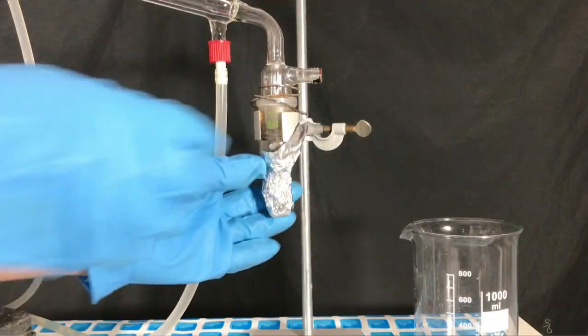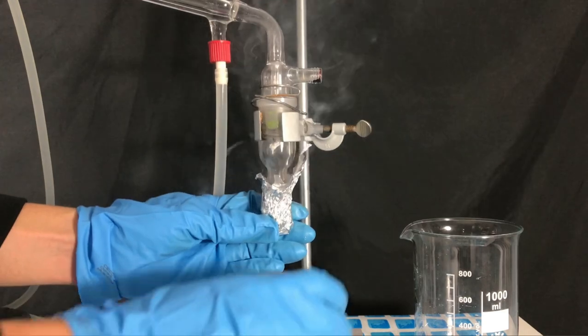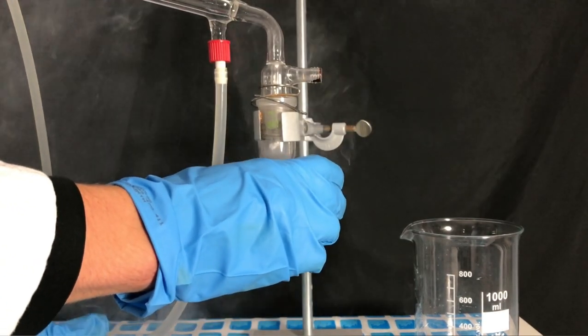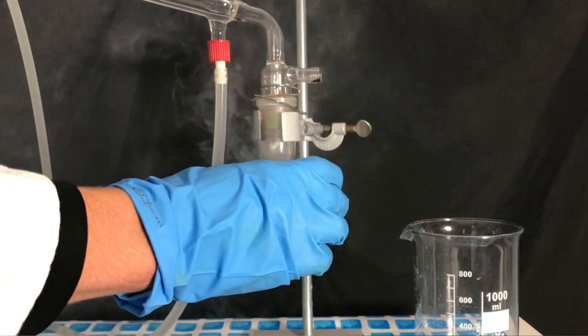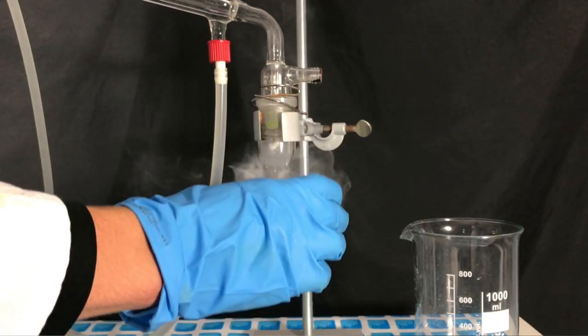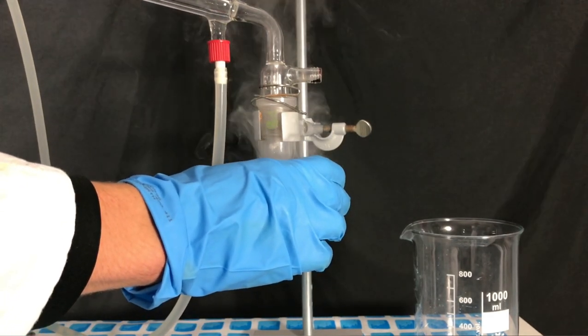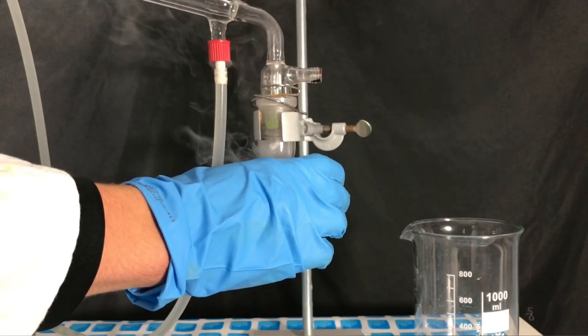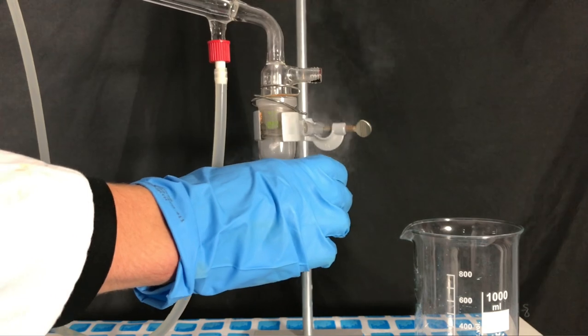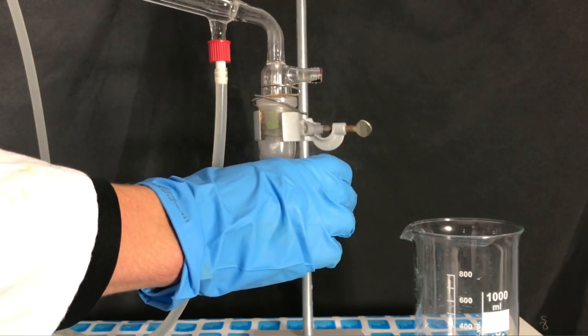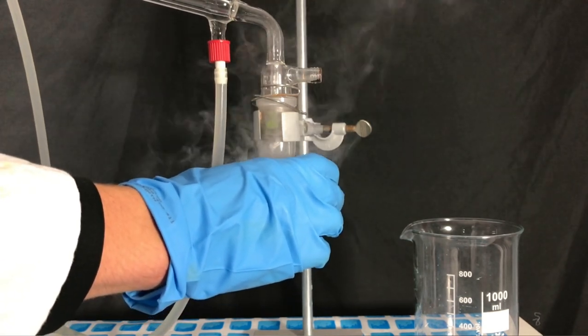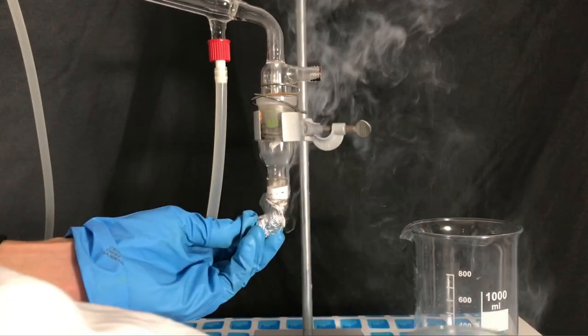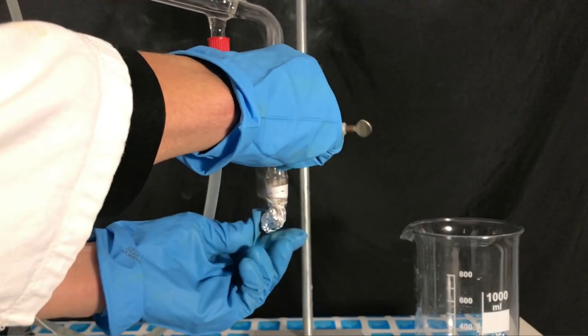But before proceeding I decided to do the cleanup. The sulfur trioxide remaining in the apparatus must first be neutralized with concentrated sulfuric acid forming oleum. Water cannot be used as water would react extremely violently with sulfur trioxide. It was too much of a hustle to film this part actually but we basically dipped the parts, the open parts, into some concentrated sulfuric acid and we also let some concentrated sulfuric acid flow through the distillation bridge.